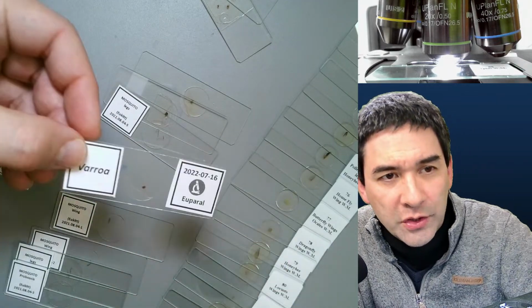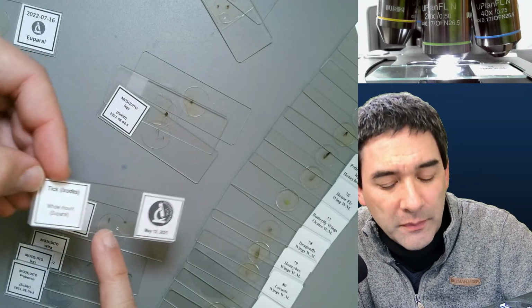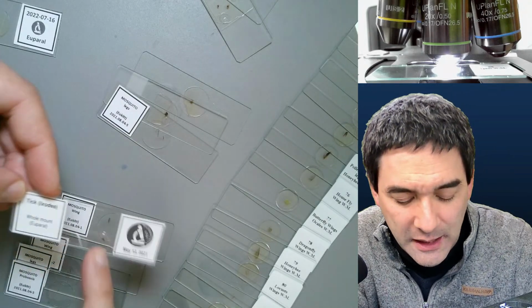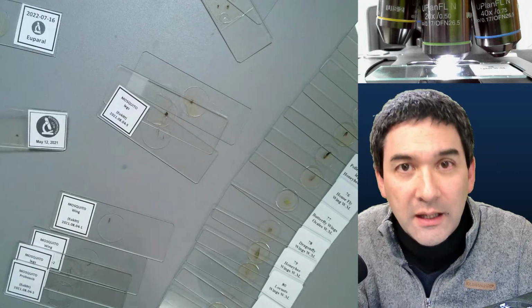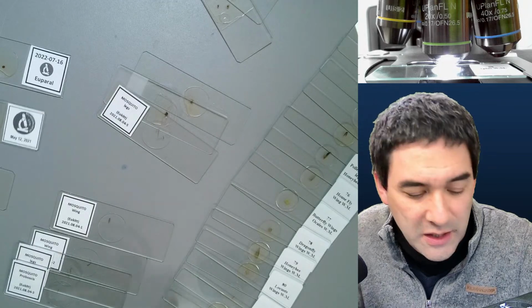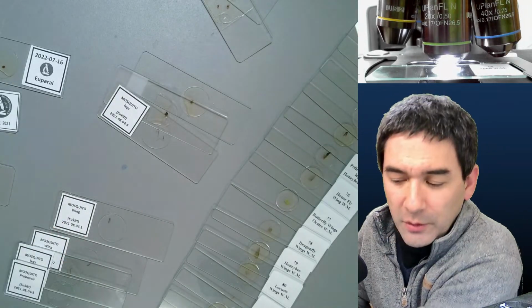You might wonder where I got those, not the Varroa one, the ticks. Where did I get those ticks from? Well, every time I got bitten by a tick, not a good thing to happen, I pulled it out of my skin and then I made a slide with the tick. Again, ticks are not nice things, because they do carry diseases. So that's something that you always want to be a little bit aware of.